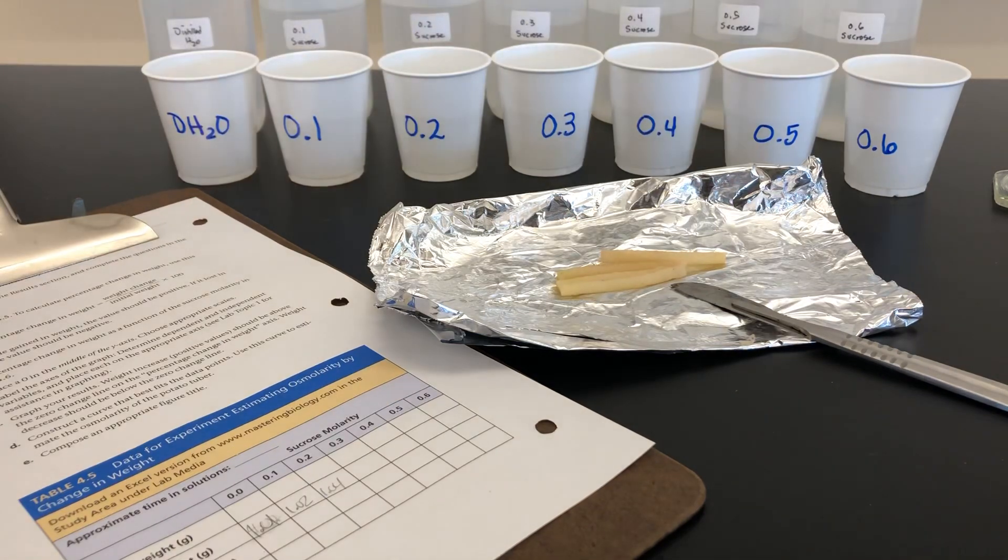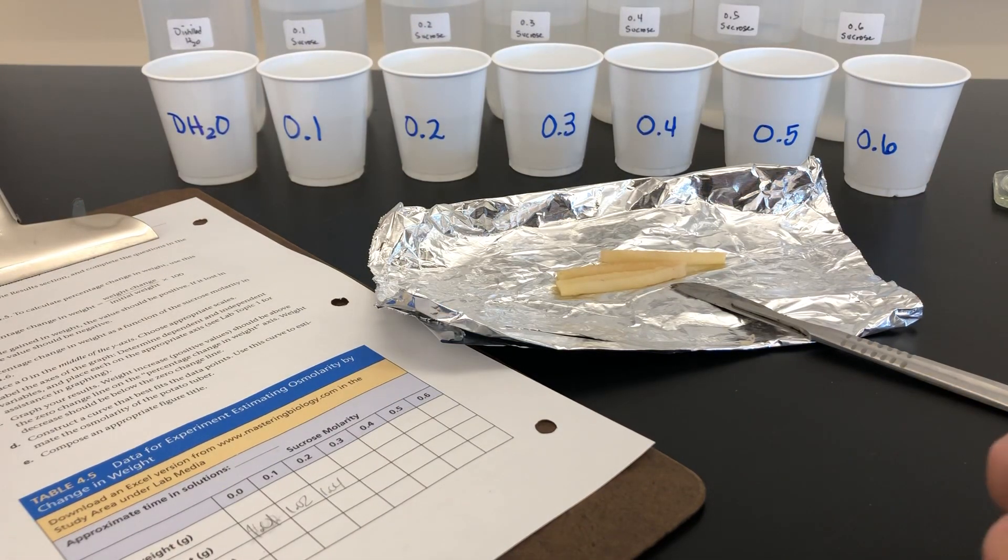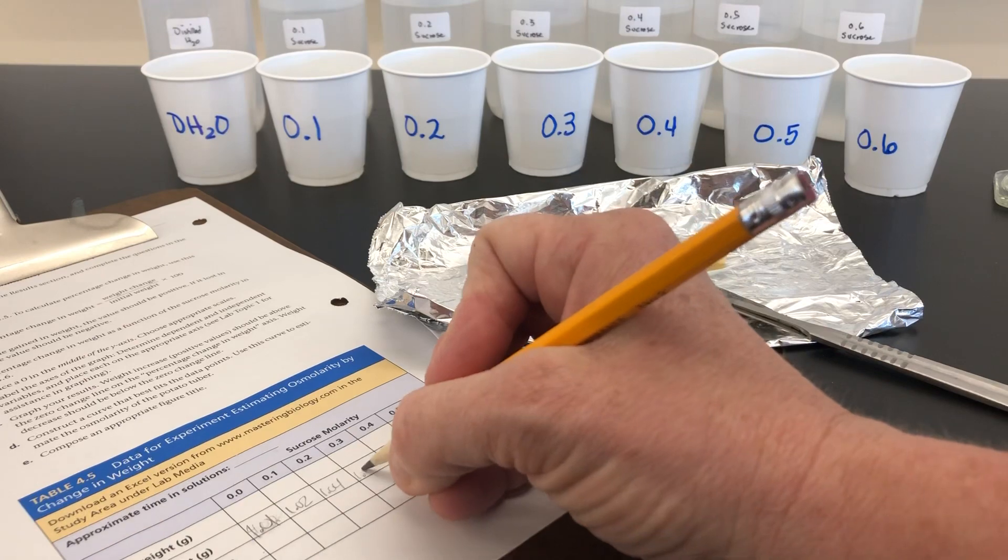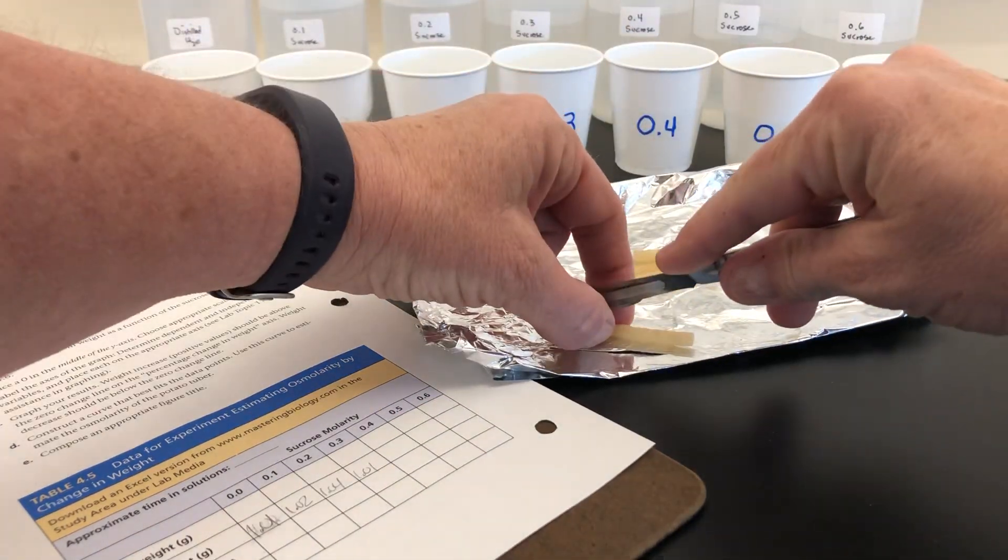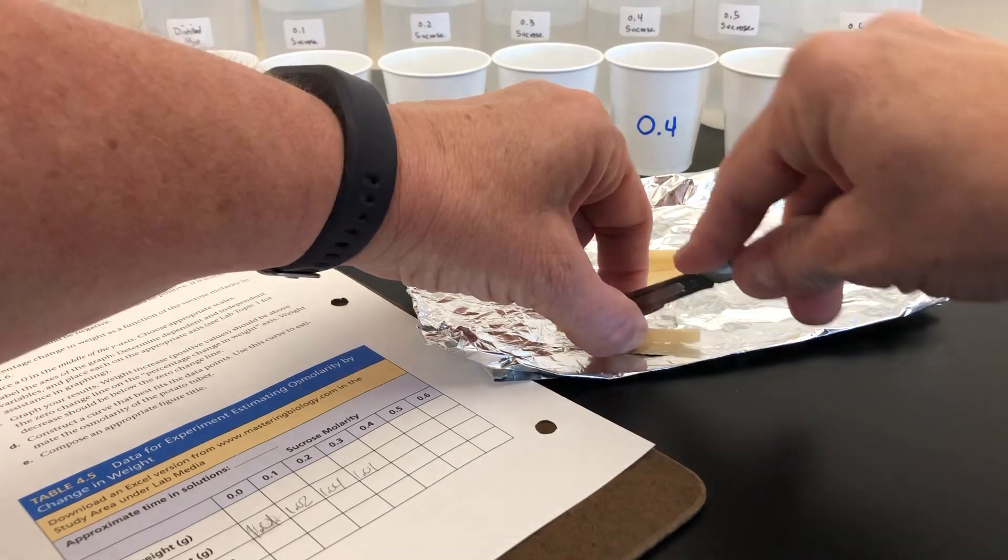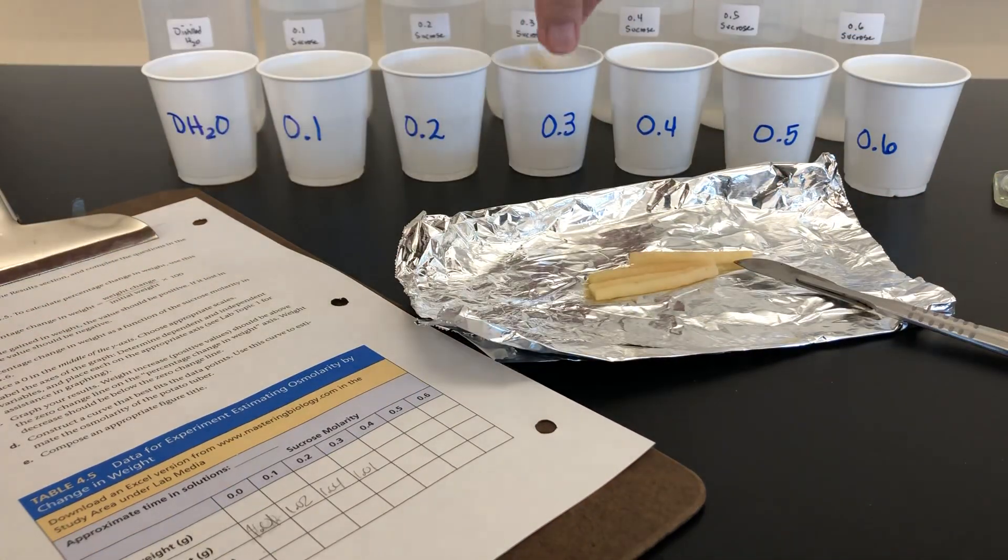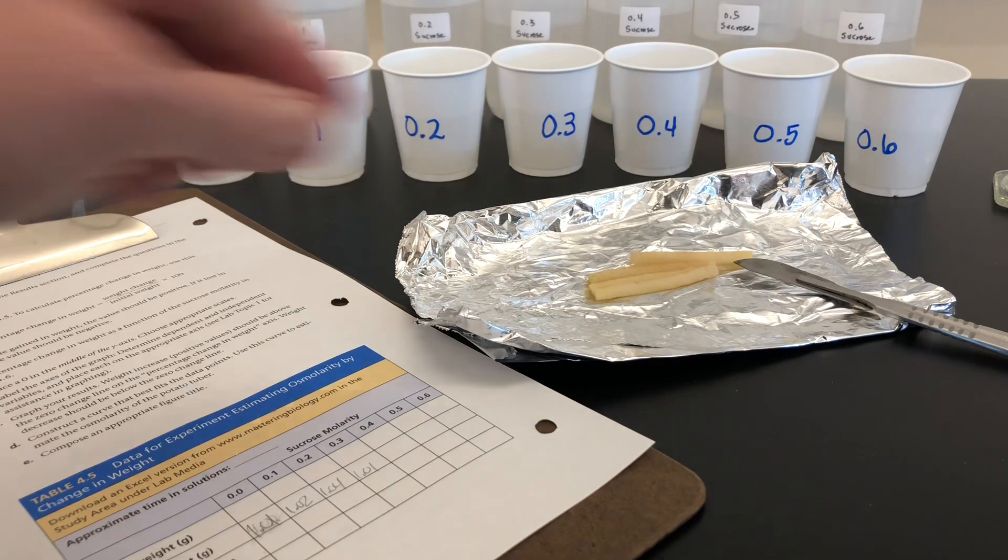Our third piece... Excuse me, fourth piece weighs 1.01 and is placed in 0.3 sucrose solution.